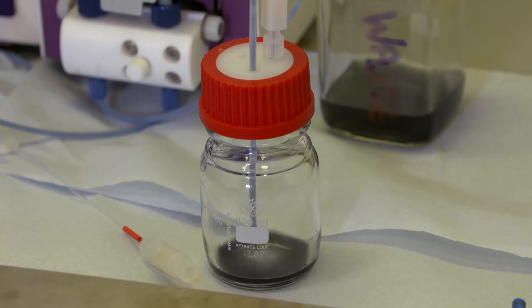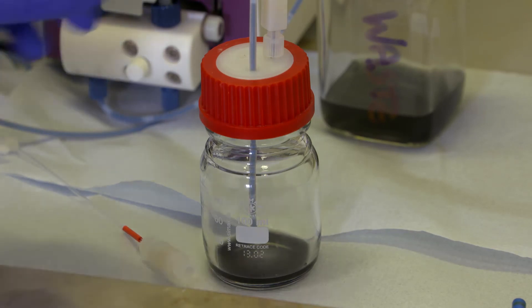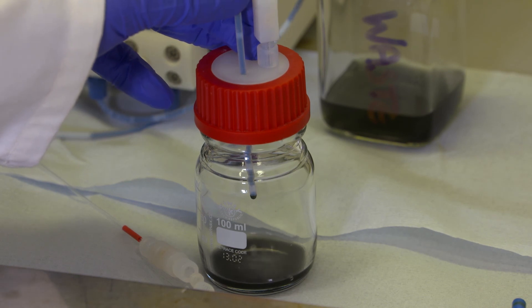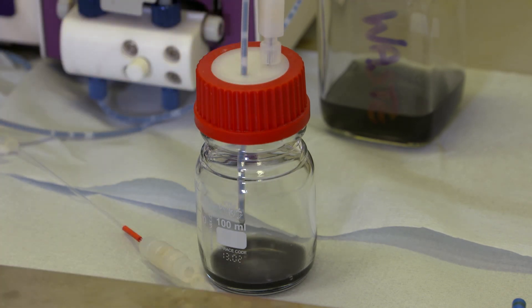Because the SF10 uses the same V3 pump technology it's able to regulate pressure even though the slurry is present. Here I'm collecting the product and I'm keeping it under nitrogen to make sure that there's no dangerous buildup of hydrogen.